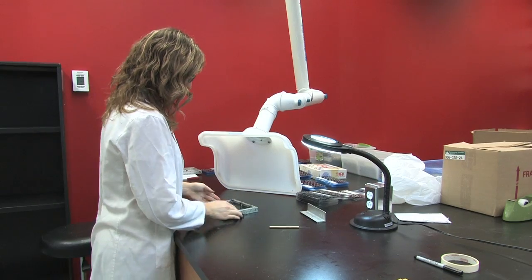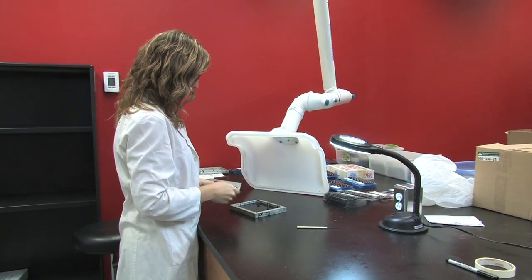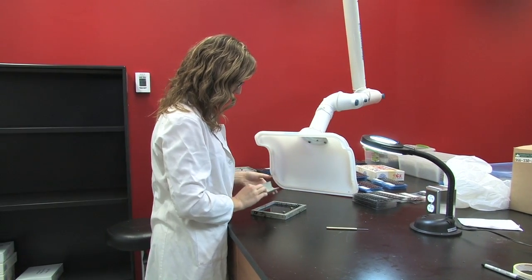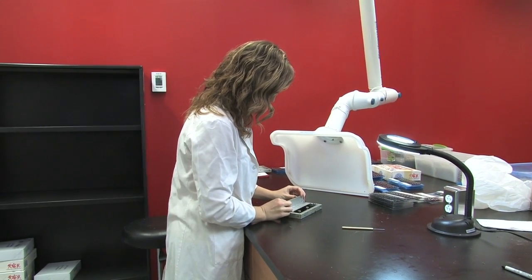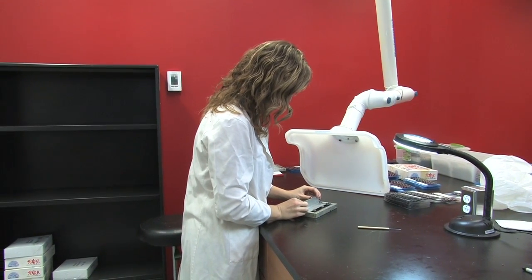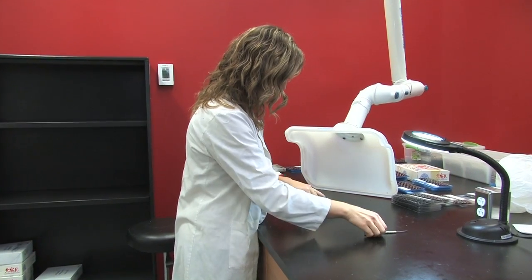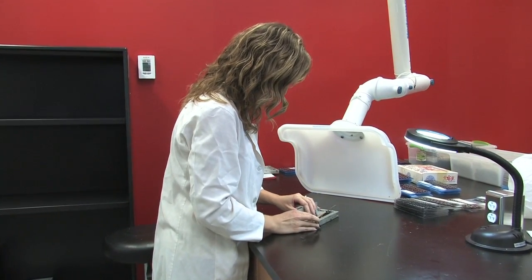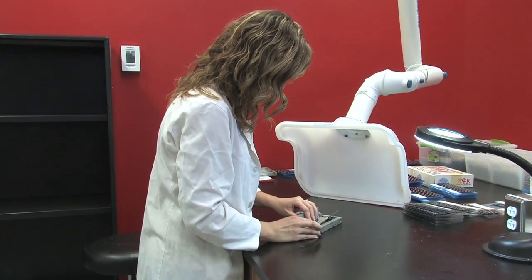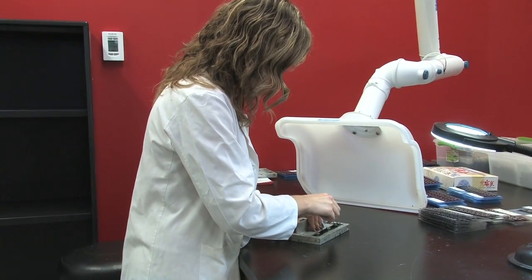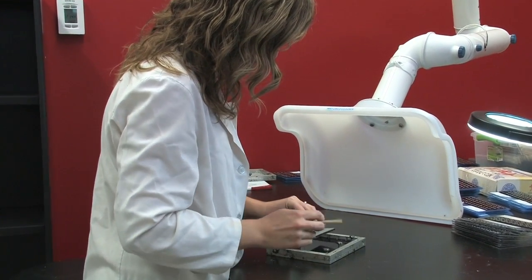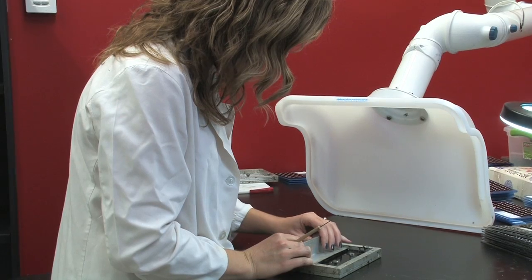We need to mark the embedding medium to create a reference line. Use a straight edge and line it up at the distal ends of the tray using the existing grooves as a guide. Score the medium with a knife or a sharp point. Create five lines in total. The otoliths will later be placed with their cores precisely lined on these marks.